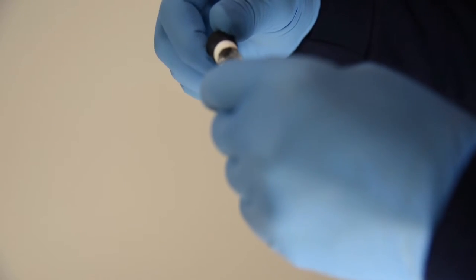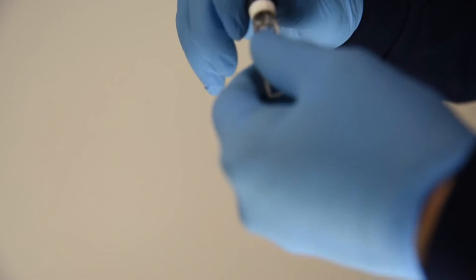Then what you want to do is screw this back on. You don't want to put too much teflon on it because otherwise you won't be able to tighten it. So what you want to do is tighten this all the way like that.